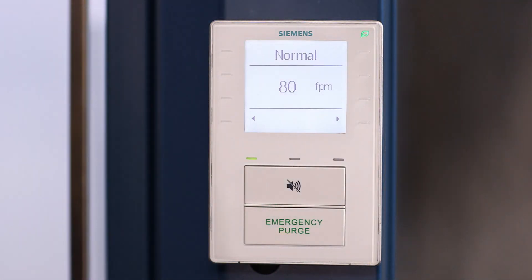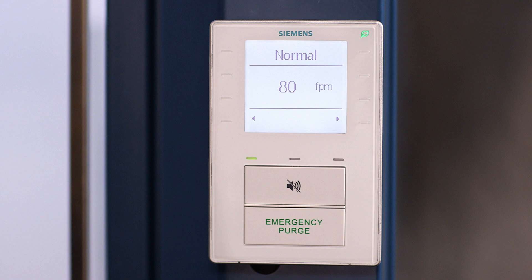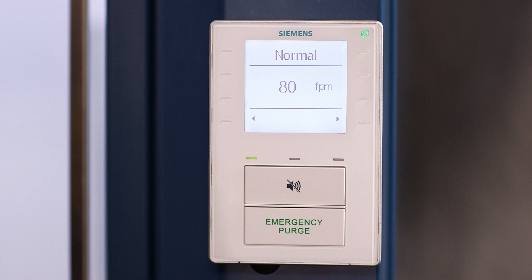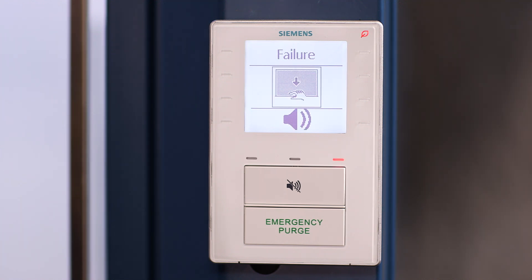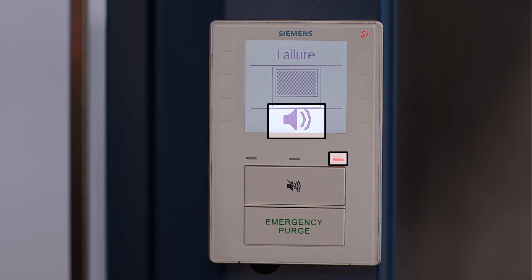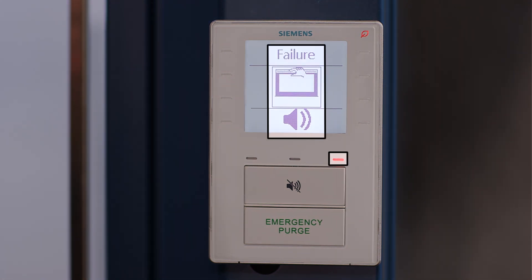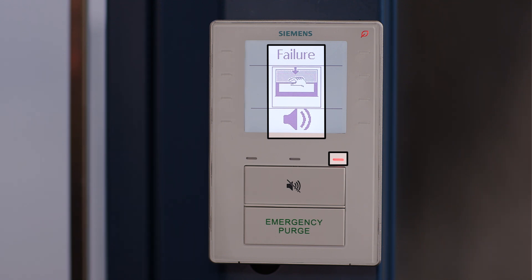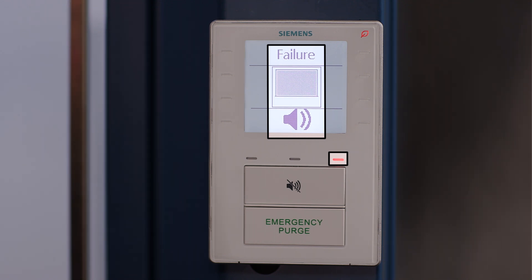Let's go back to normal mode, but this time let's assume a component has failed. The fume hood control system monitors its own connections and reports the problem. The ODP goes into alarm mode with the red indicator lighting, a constant beep sounds, and the screen message reads "failure," along with close-the-sash and audio alarm icons.